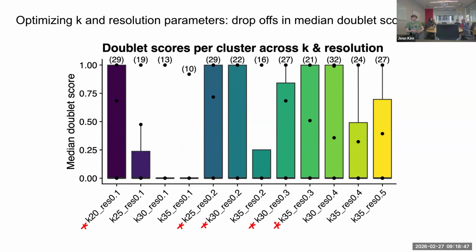which maximized the separation of median doublet scores to, for example, eliminate options like these ones on the right, where you have some more ambiguous clusters that have median doublet scores around 0.3. So if you were to try and draw a cutoff, you might be excluding a cluster that has more singlets than doublets. So I tried to basically focus in on the parameter combinations that give you a greater separation of doublet scores. And then also here I aimed for 20 to 30 clusters within the resolutions, because if you drop some of the clusters, for example on this 19, 13, or 10 range, you might be left with fewer numbers of clusters that might not be as informative for your data.